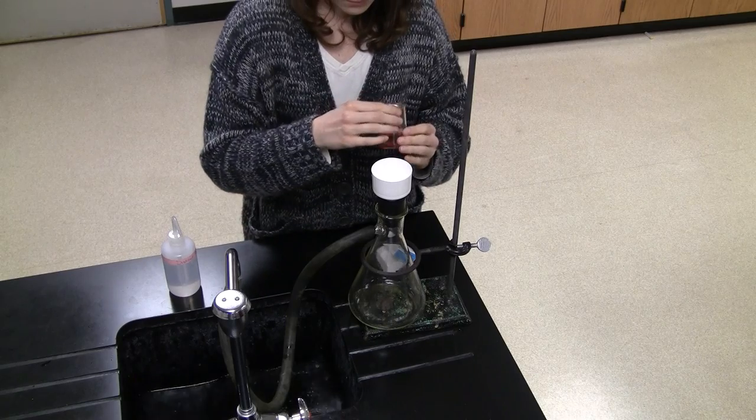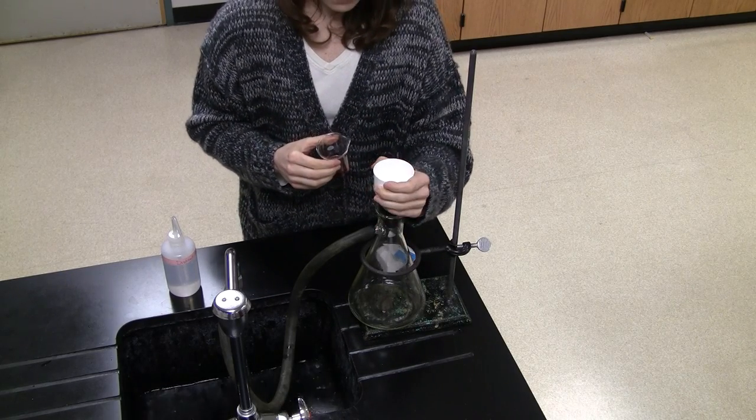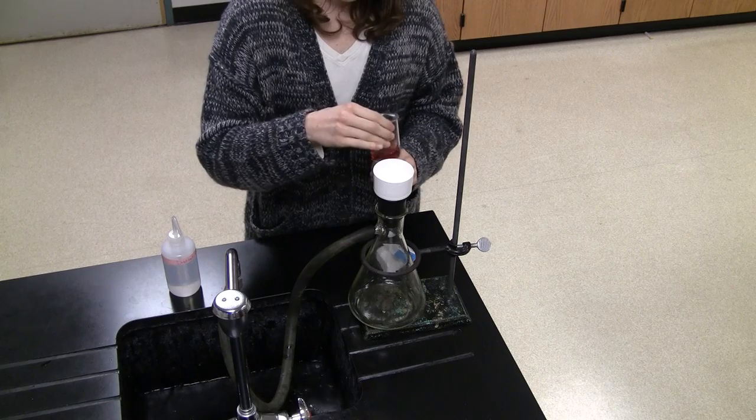If need be, press down on the sides of the funnel to create a better seal. Now the setup is ready to filter.